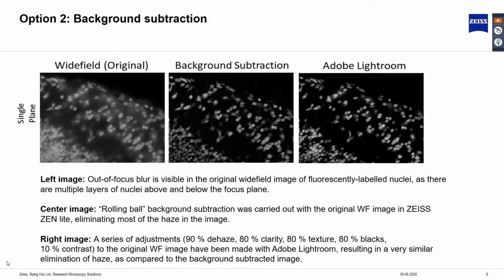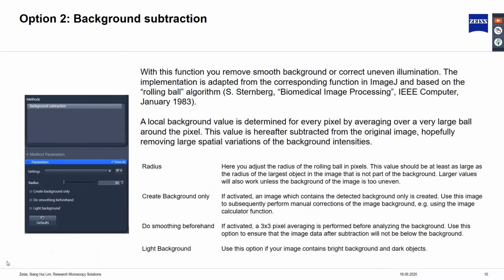In both examples, most of the haze in the processed image is eliminated to give us better image contrast. Like unsharp masking, the background subtraction function is also available in Zen imaging software as a post-processing method. With this function, you can remove smooth background or correct uneven illumination with the so-called rolling ball background subtraction algorithm. This rolling ball algorithm is similar to the one implemented in ImageJ.